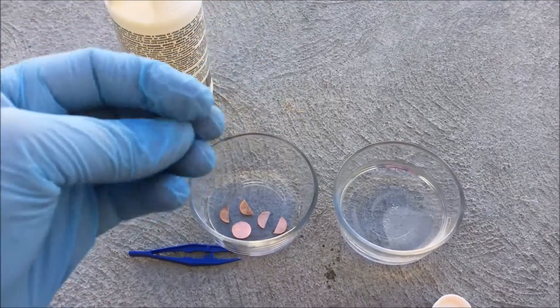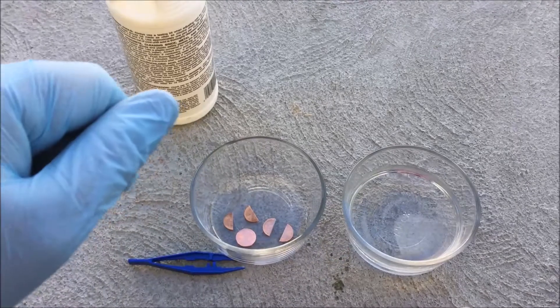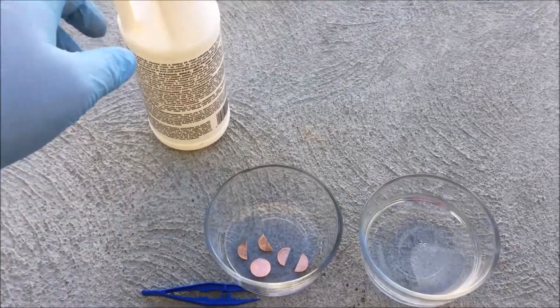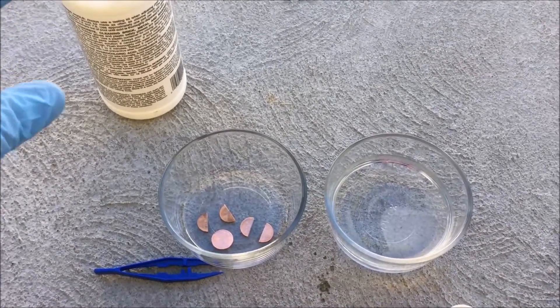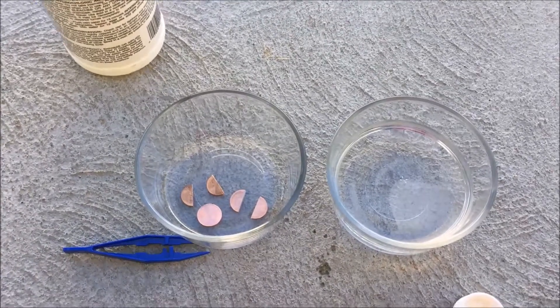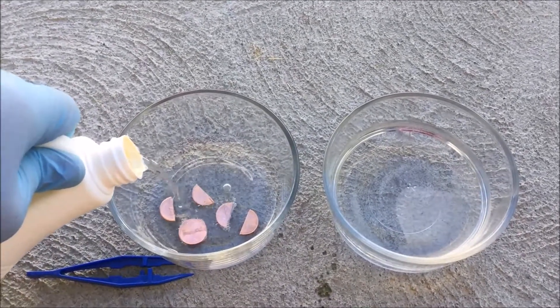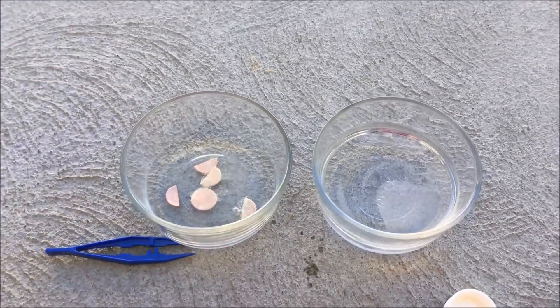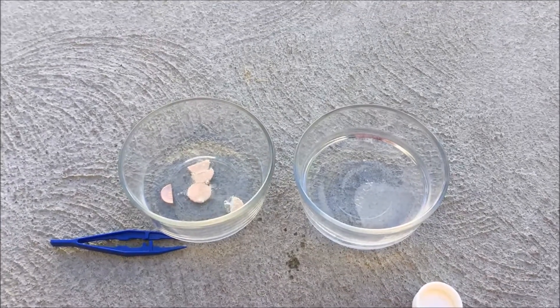I've moved outside and set up. I've got my personal protective equipment on — gloves and safety glasses. I've added water to the rinse container and placed the two zinc pennies and the copper penny in the empty one. I'm now going to pour the acid in, nice and gently to avoid splashing. I already got a little bit on the concrete taking the lid off. I'm not sure how long this will take, so I'll have you watching it up close on a time lapse. I think it'll be pretty quick — we'll get back to it after they're hollow.